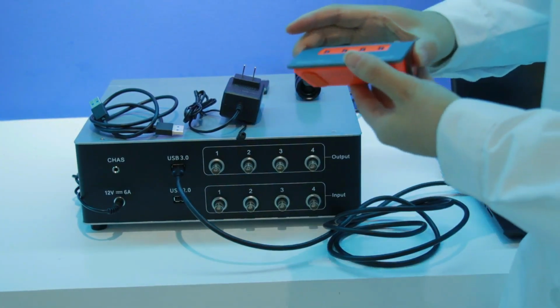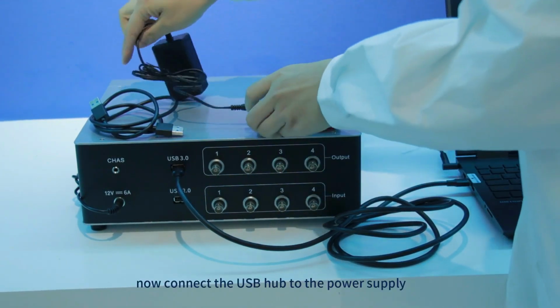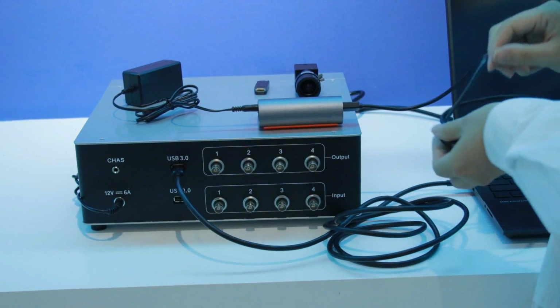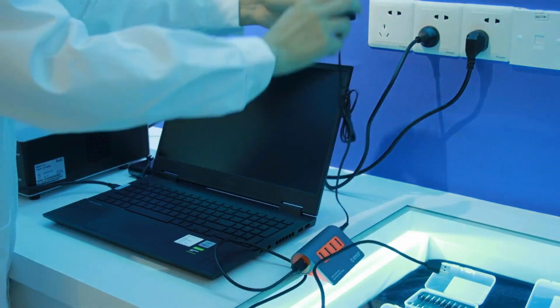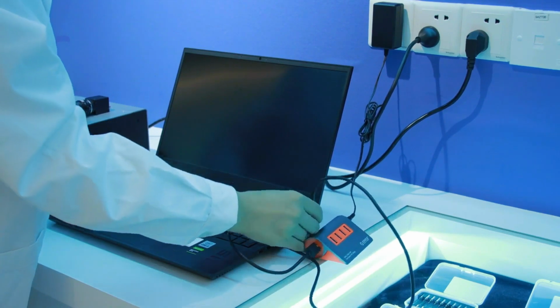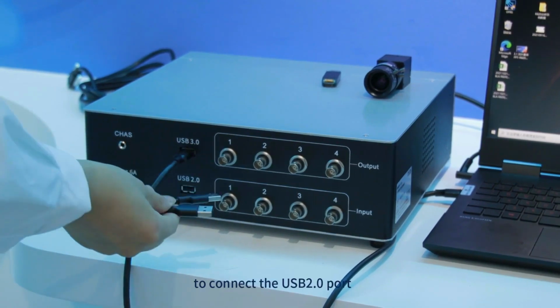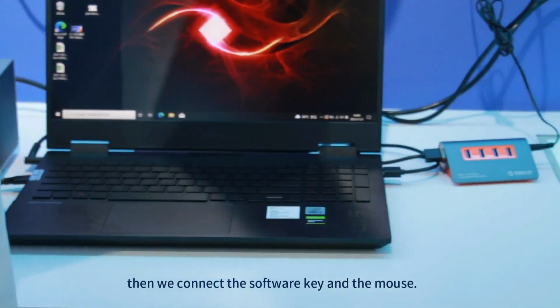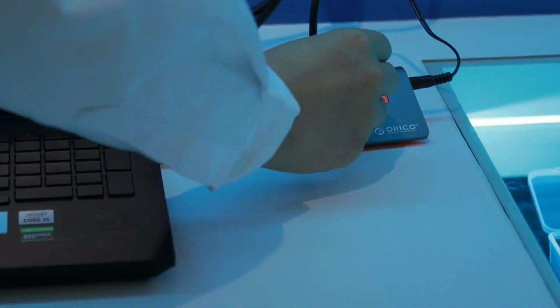In case the computer's USB ports are not enough, we can choose the USB hub included in the system. Now connect the USB hub to the power supply and the computer. Then select the USB 2 cable to connect the USB 2 port on the back of the machine to the hub. Then we connect the software key and the mouse.